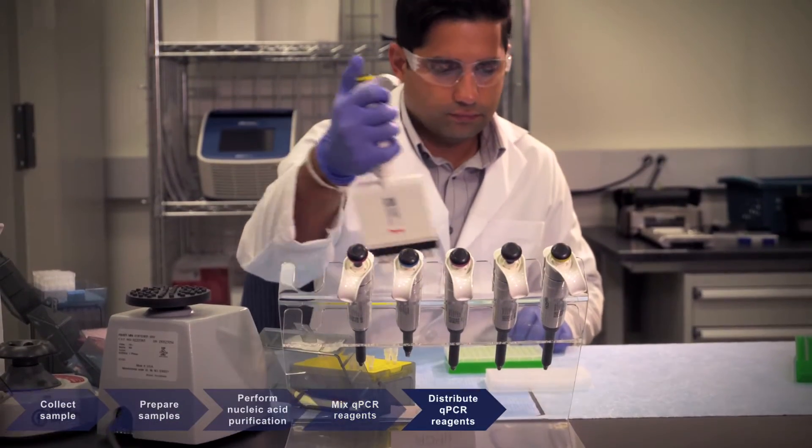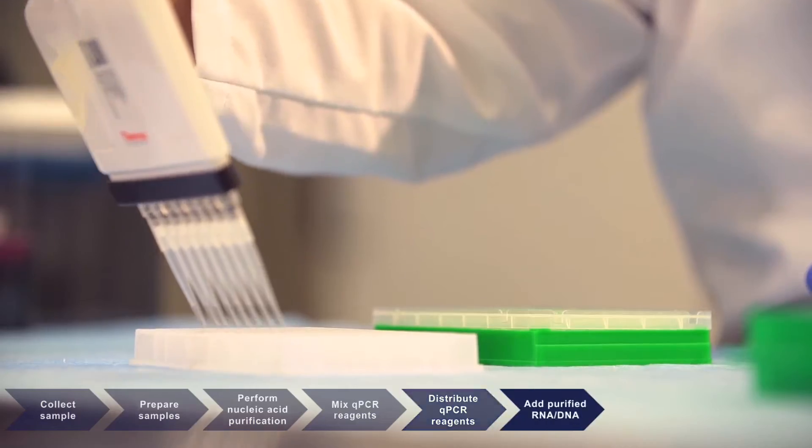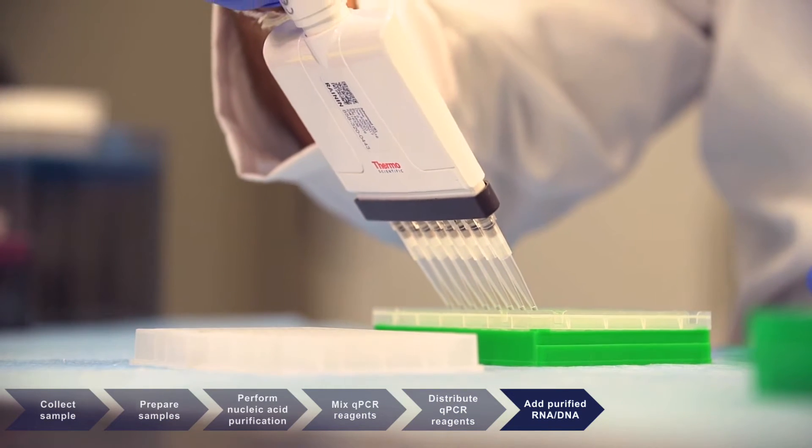Distribute reagents to a PCR plate and add purified RNA or DNA to each of the reaction wells.